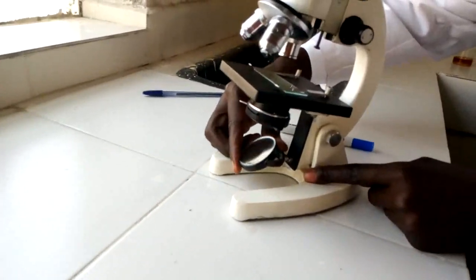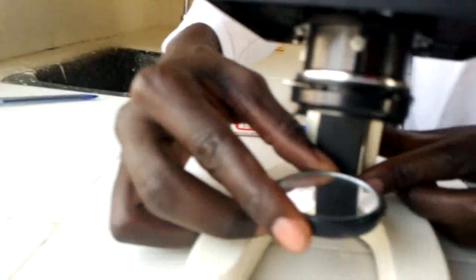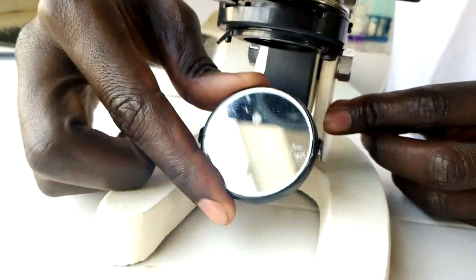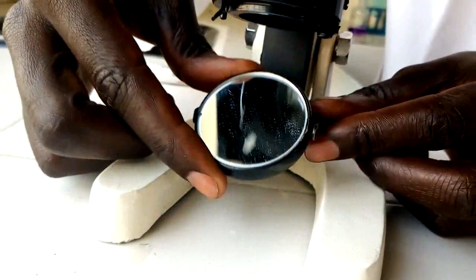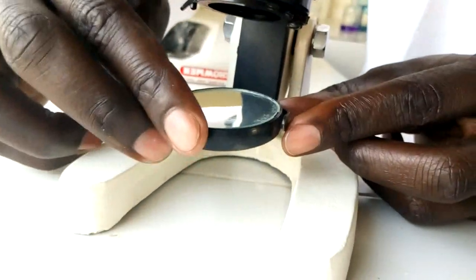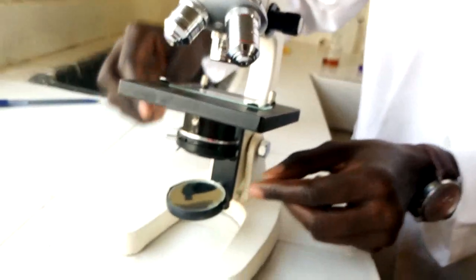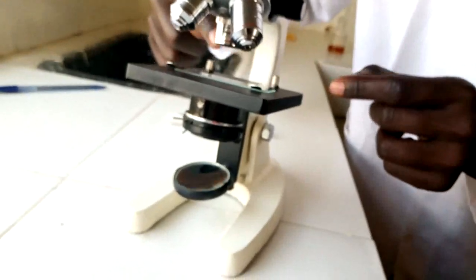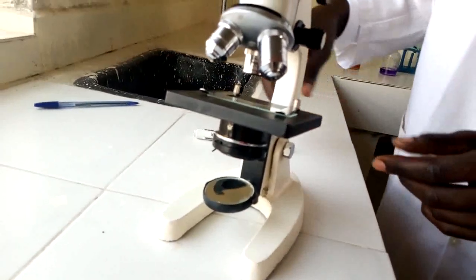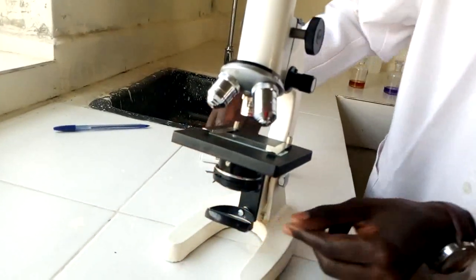We also have another part referred to as the mirror. The function of the mirror is to reflect light to the stage. This reflection is done through the condenser, and this gives a bright field of view — that is the area where I look at the image through the eyepiece lens.